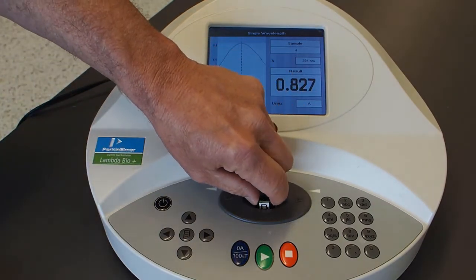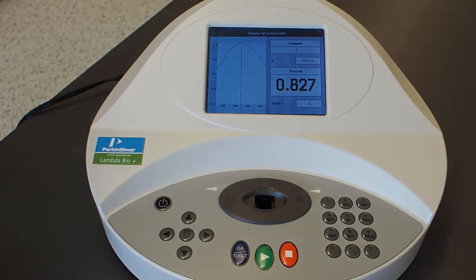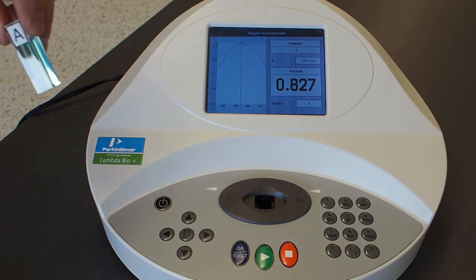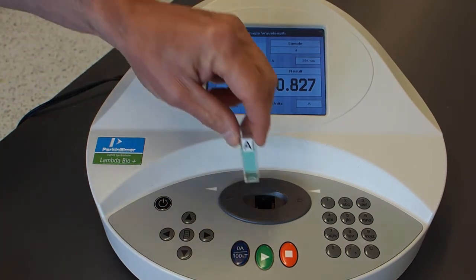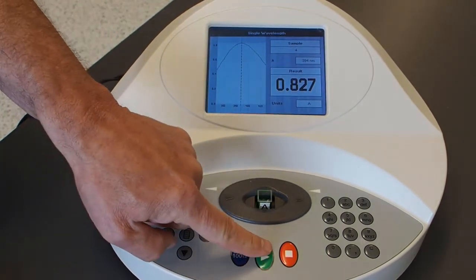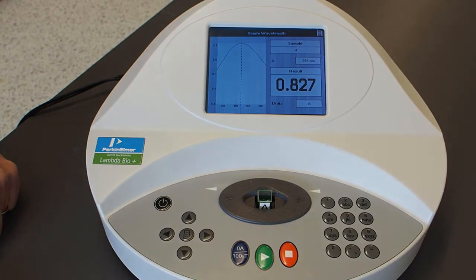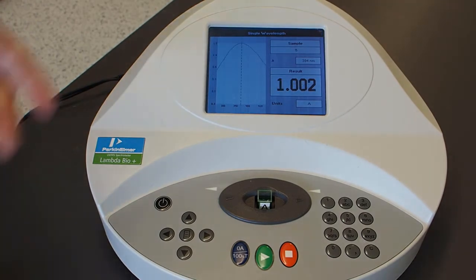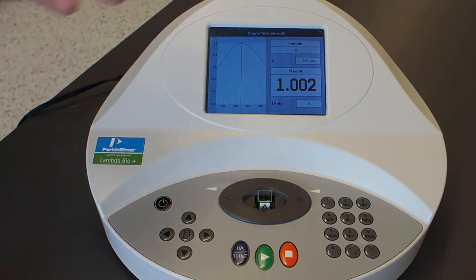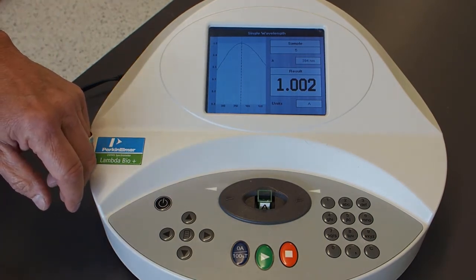Sample B is 0.827. Remember, as we discussed earlier, the percentage of light going through when you have an absorbance of 1 is only around 10%, so we don't want absorbance values much greater than 1. Sample A, our most concentrated one, is 1.002 — not close to 1 for any particular reason, just a coincidence from the samples we made up.